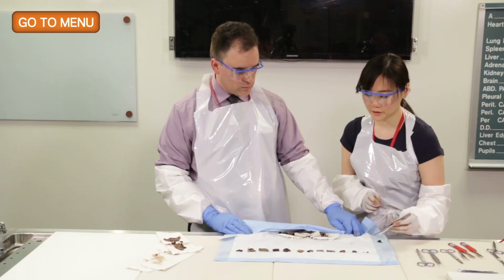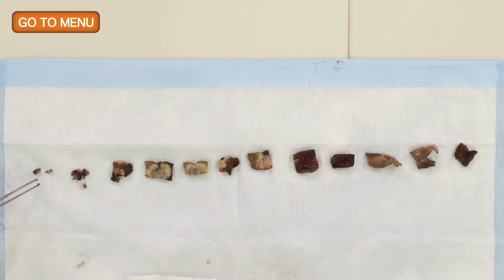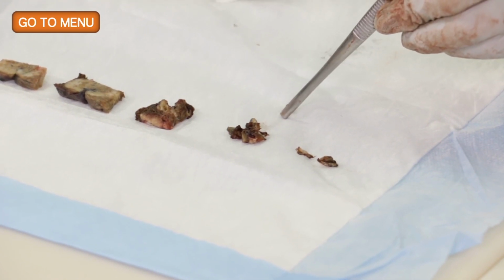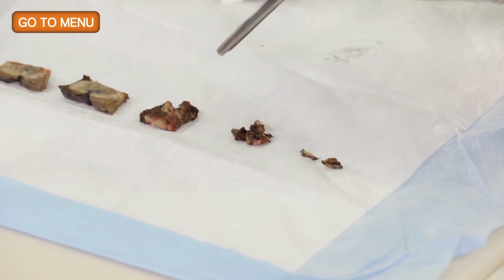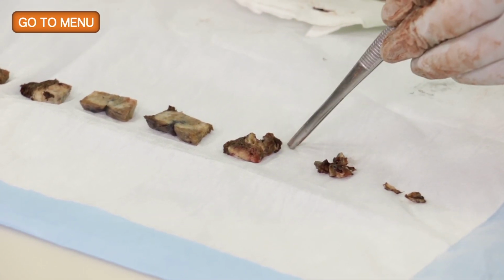So for the first submission, we have the bronchovascular margin, in which we shave off the margin and we put the margin of interest face down into the cassette. The next that we submit are all our lymph nodes that we find. And the section after is the tumor to the bronchovascular margin, the closest to.